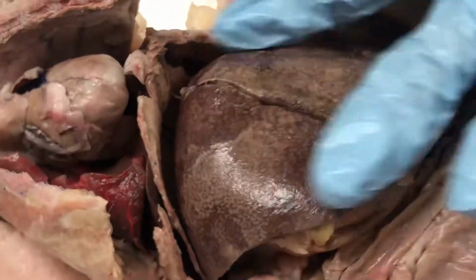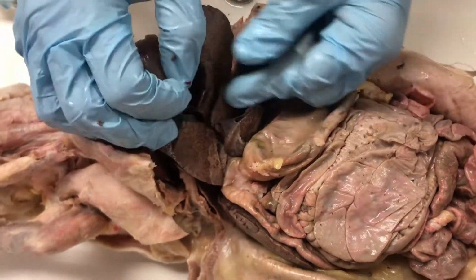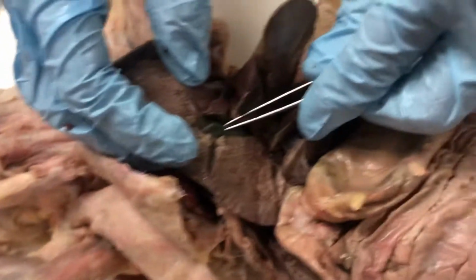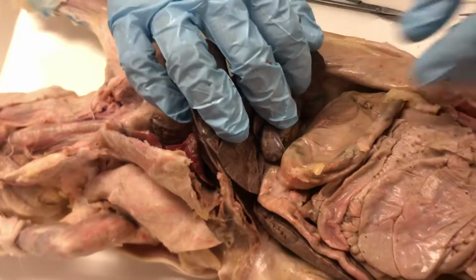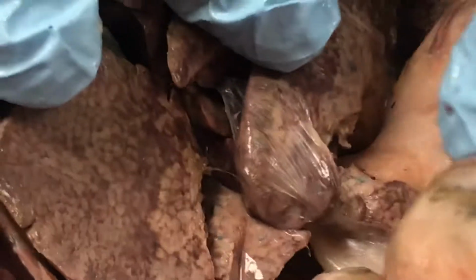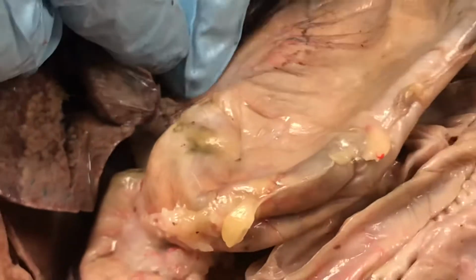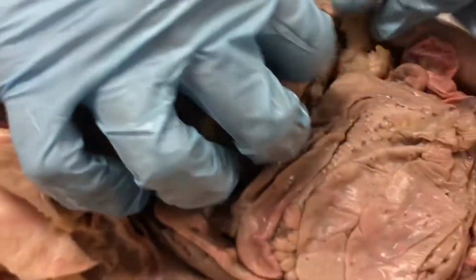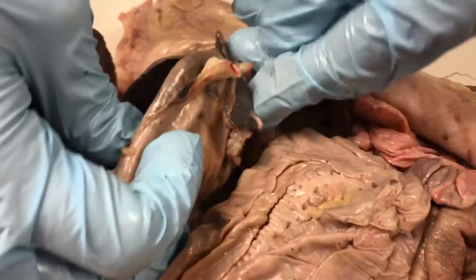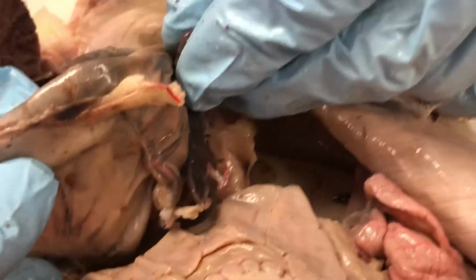This large organ is the liver. And if you pull up the liver, you'll be able to see this green tinted structure over here, which is the gallbladder, which stores the bile. Also, kind of underneath the liver, you're going to find the stomach. As we look at the stomach here, you can find the esophagus, which of course brings the food into the stomach. Lateral to the stomach, you're going to find this funky structure. It looks kind of like the same tissue as the liver, but this is the spleen over here.